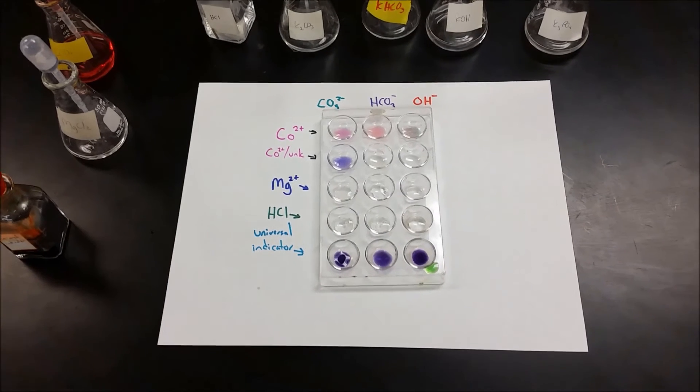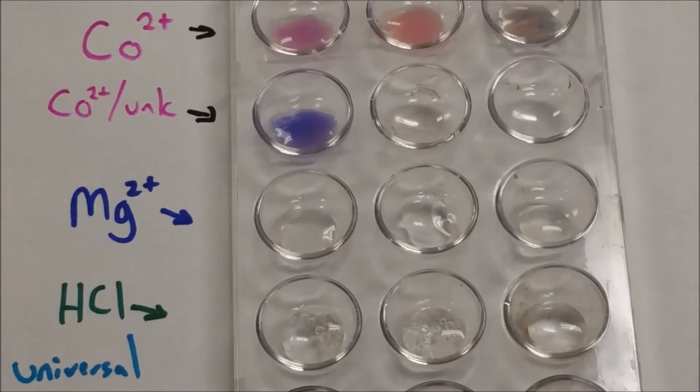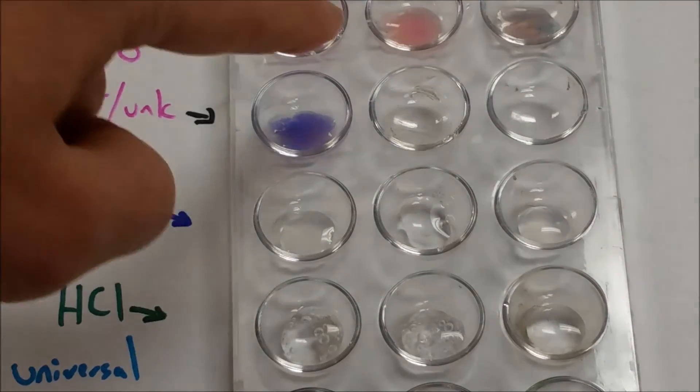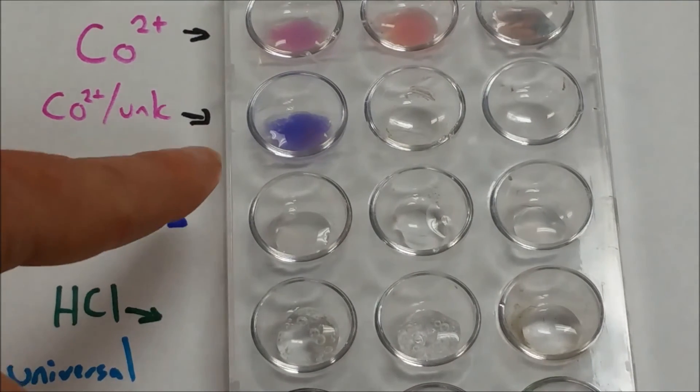I'm going to zoom in now. So very subtle differences in the two precipitates here, but you can see the hydroxide is different. The unknown doesn't match either one.